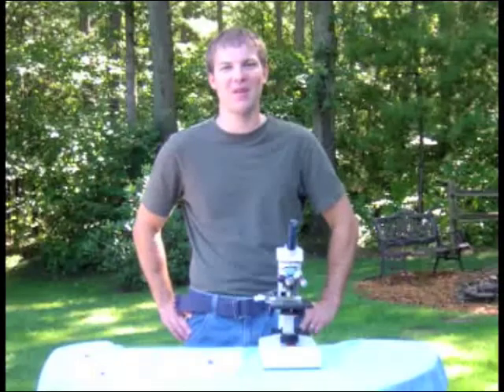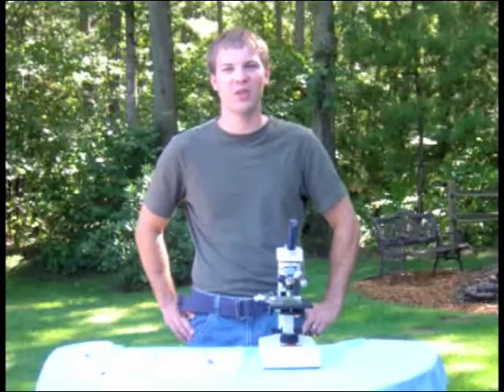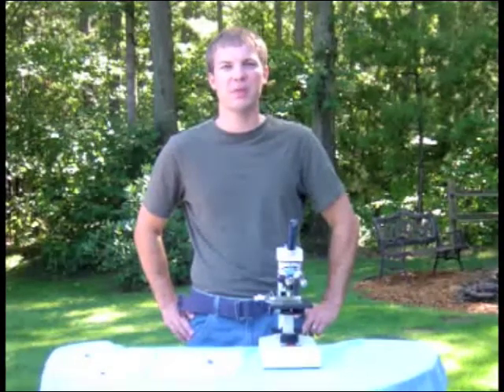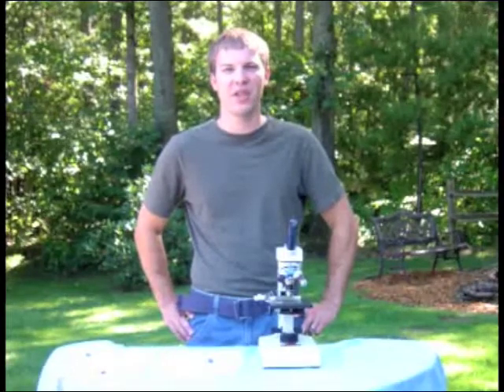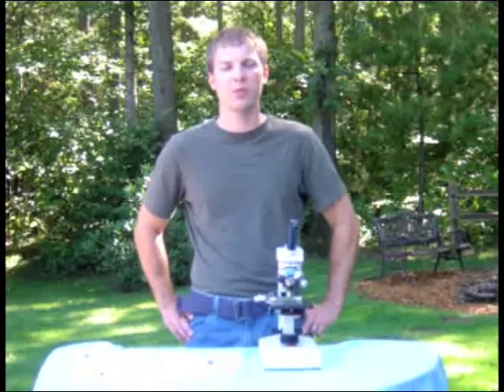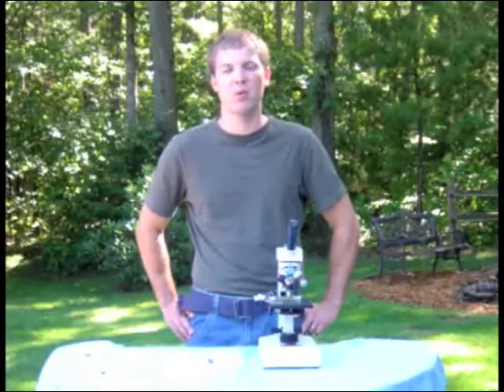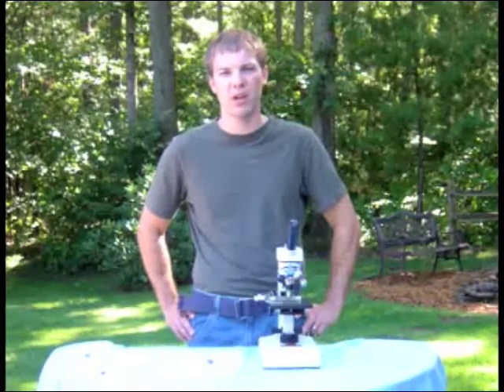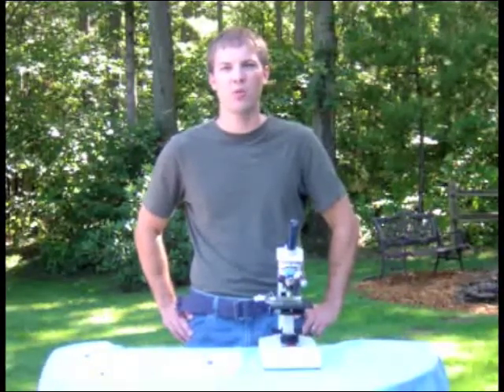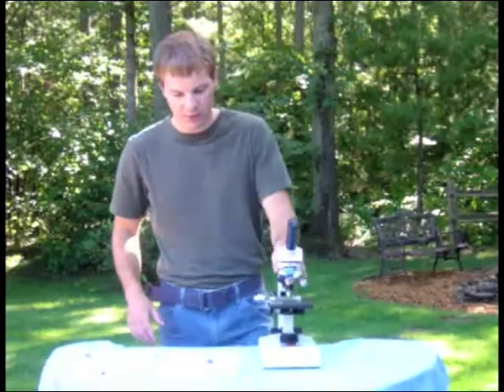Hello and welcome to the first ever biology podcast. The purpose of these podcasts is to help teach you skills that you'll need to be successful in biology this year. So today we'll be talking about the parts of the microscope. Biologists rely heavily on microscopes to explore the microscopic world, and it's important that you know the parts and how to use the microscope successfully. So let's go over the basic parts of the microscope.